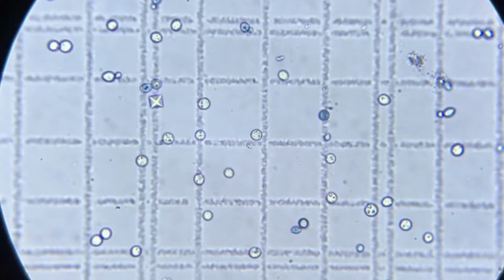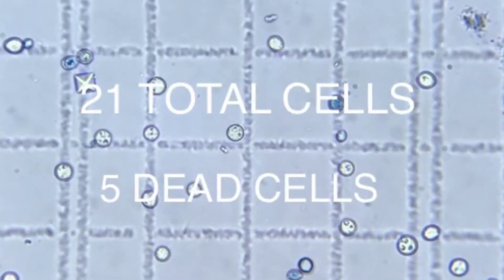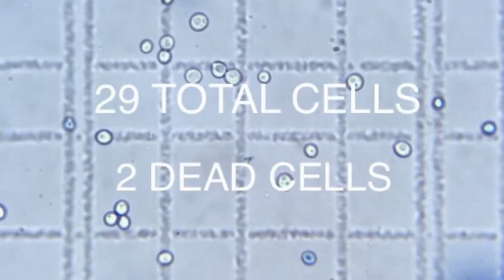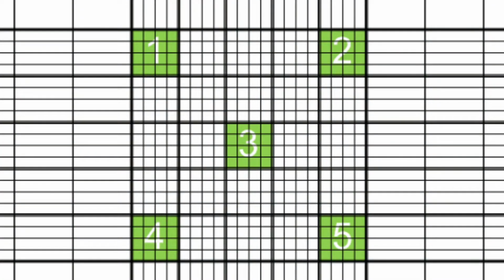So for the first grid in our count, I counted a total of 21 cells, with 5 of them stained blue. Now we repeat the process in the opposite corner. After you've counted all 5 squares, you're ready to do your calculations.